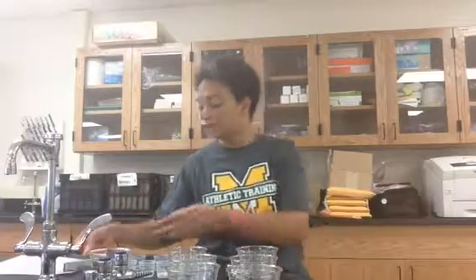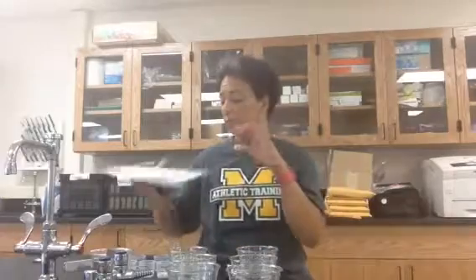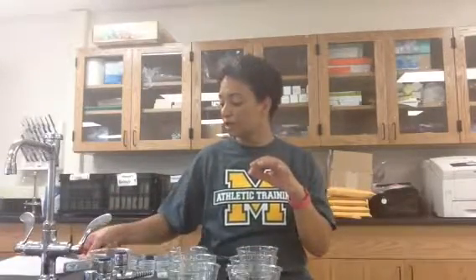I'm just going to dip it in until it's wet, and then stick it on my organizational table at 0 minutes. Depending on your class, you either need to wait for 1 minute or 3 minutes to read those strips. Your teacher will tell you what kind of strips you have. Once I have tested all of my clear liquids for glucose, I'm going to pour the milk in and start the timer. I'm going to test them again at 2 minutes and then again at 7 minutes.